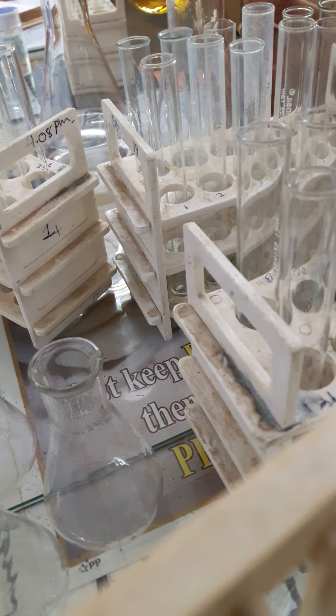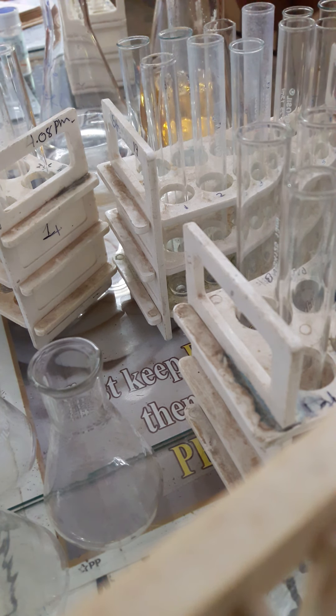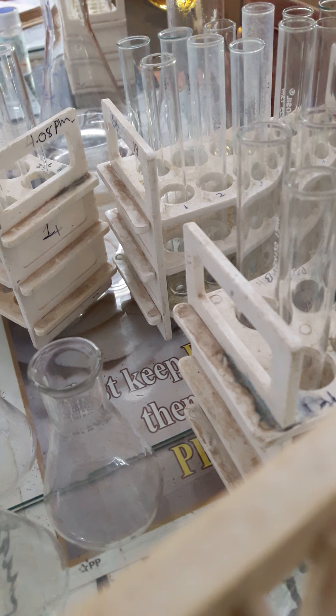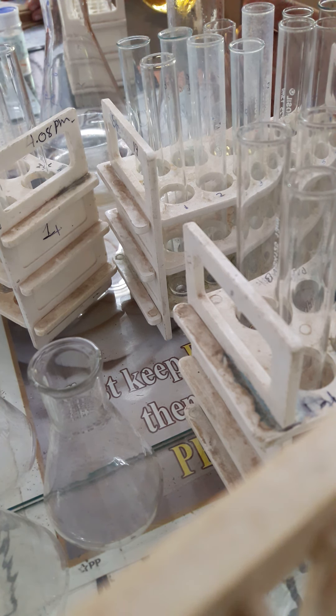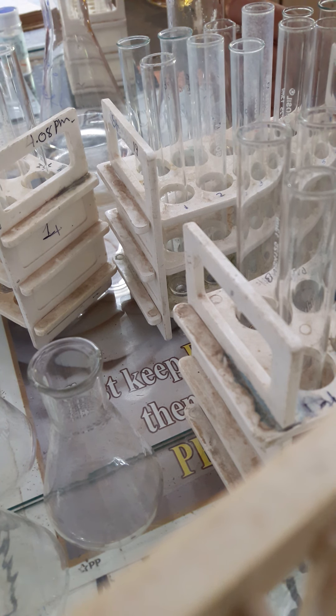We are adding iodine in tubes and they are being filled and kept in the rack. This is the same way you have done in your first year when you estimated the activity of amylase.